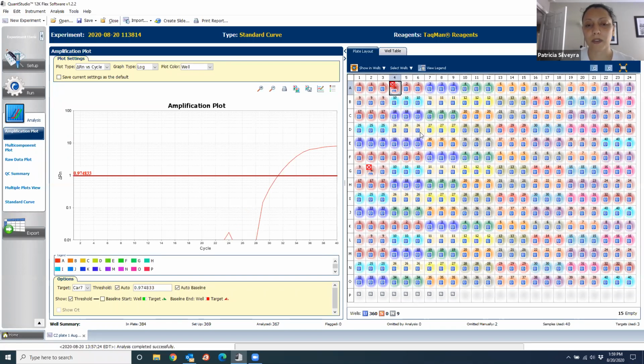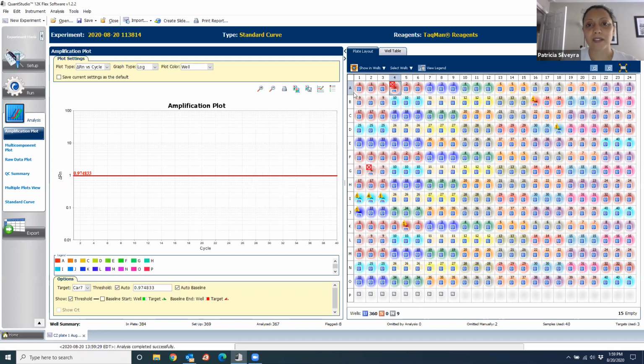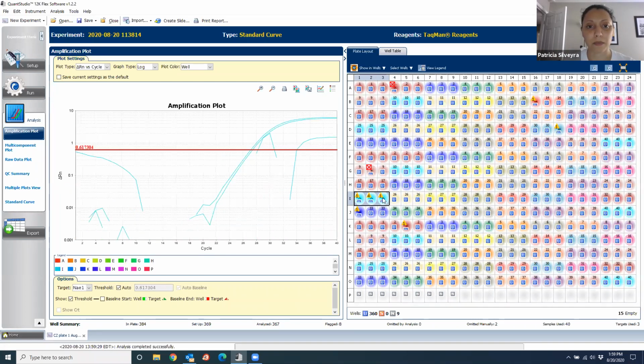And the thing is, when you omit something, you can always go back and include it. So you still right click, and instead of omit, you click include, and it goes back. So if you are in doubt, you can always go back later and omit or include things. Every time that you change one of those, as I told you, you have to reanalyze. And now we're going to go here because this looks a little problematic. Okay, so here you go. We have these 3 wells that look very different from each other.